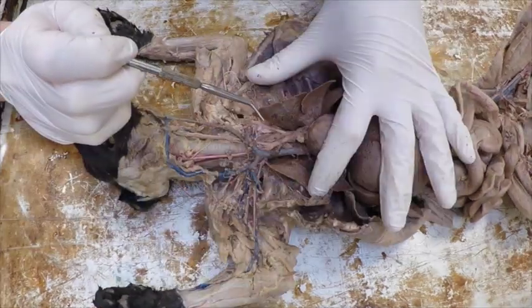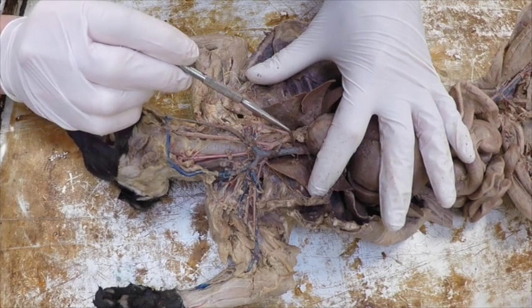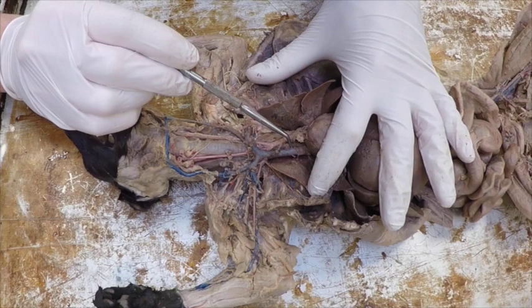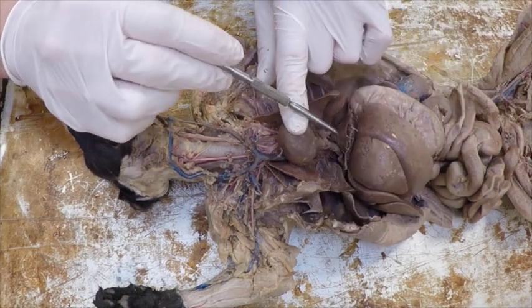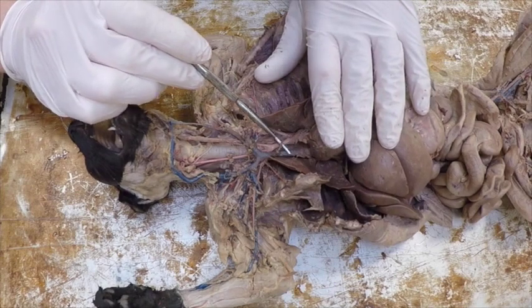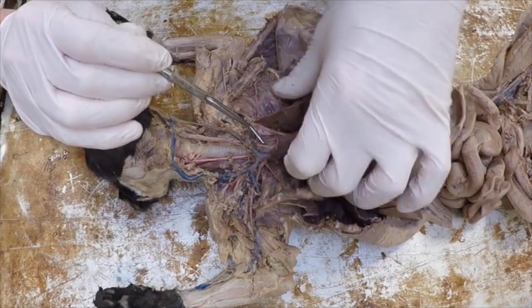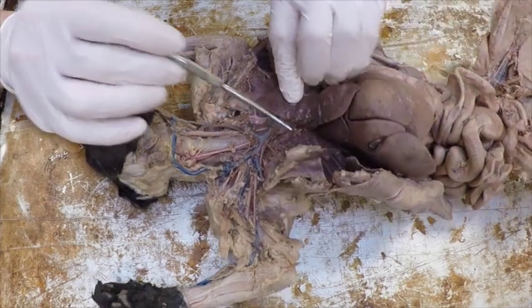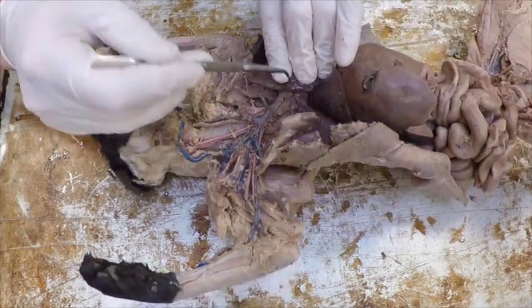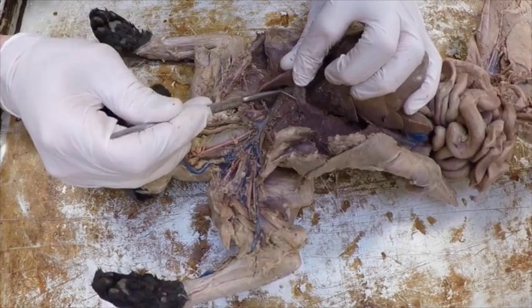Now we're going to work through the blood vessels, and we're going to go through the veins first. Coming out of the top of the heart is the superior vena cava. The bottom side of the heart has an inferior vena cava. If we follow the superior vena cava on up, we hit the internal mammary right here. Back behind the lungs, if we pull this over, I can see what's called the azygous vein. It goes back down and around. It's kind of hard to see and the ribs are getting in the way.